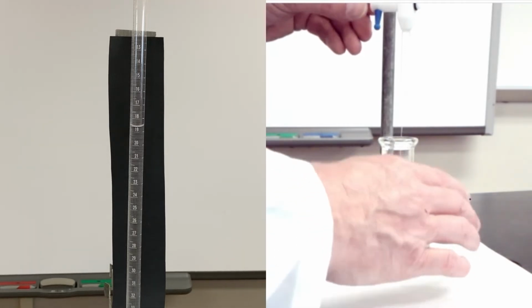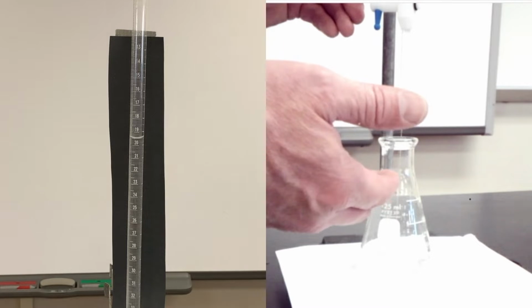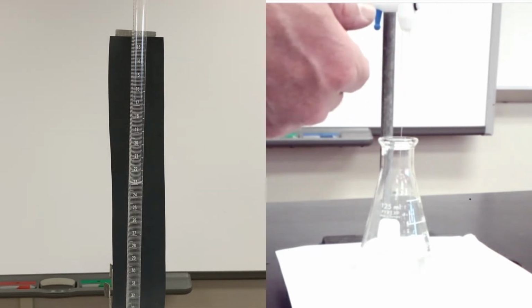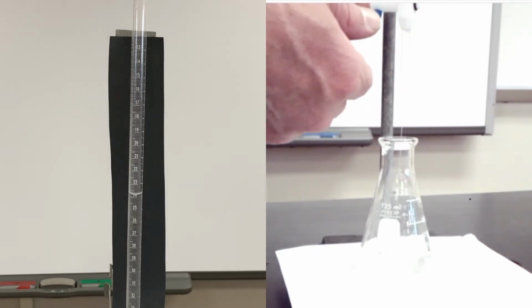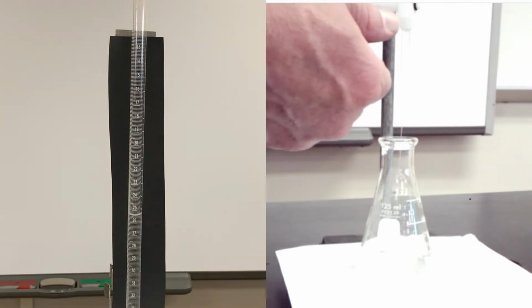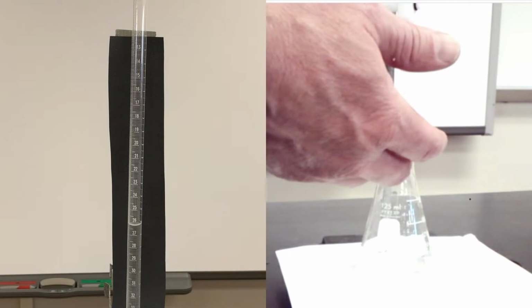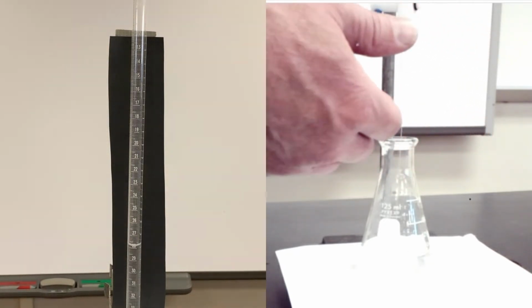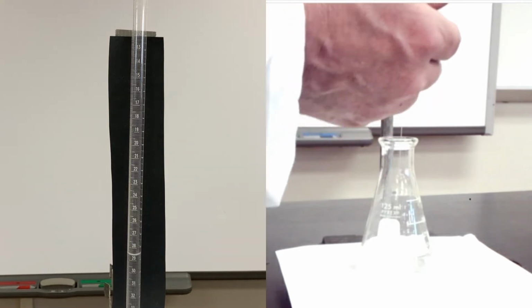And we're gonna do the exact same thing for trial 3, okay? We're gonna record our initial volume, which will probably be right around 30.3. And of course, add our acid and then our base and titrate the same way. 3 trials makes it so that we can get an average and have a nice, precise, and accurate result.